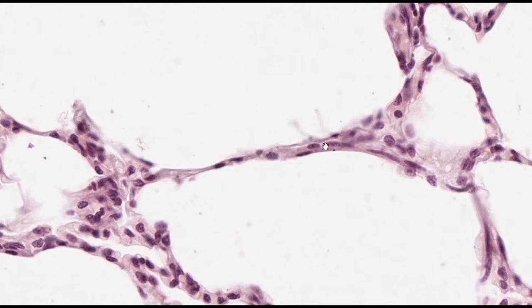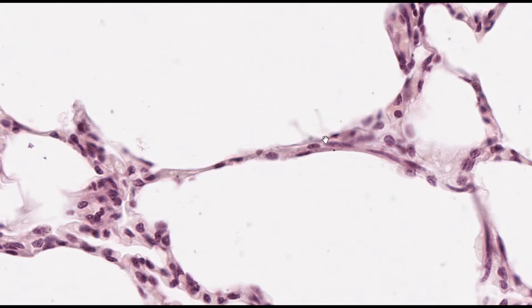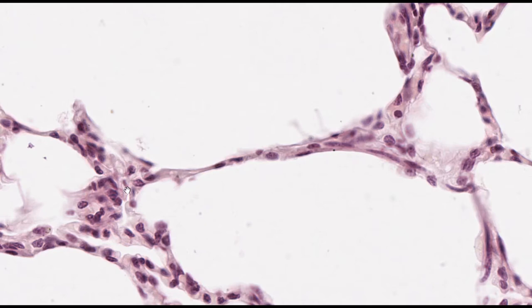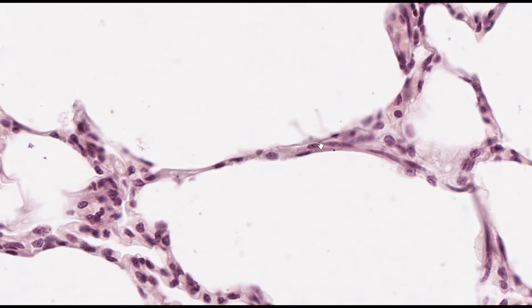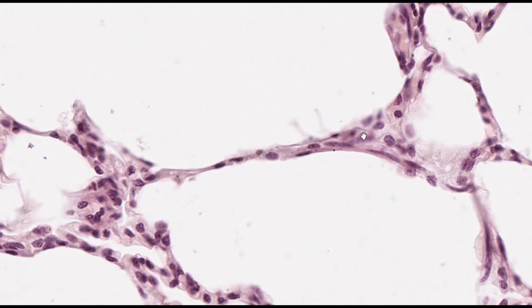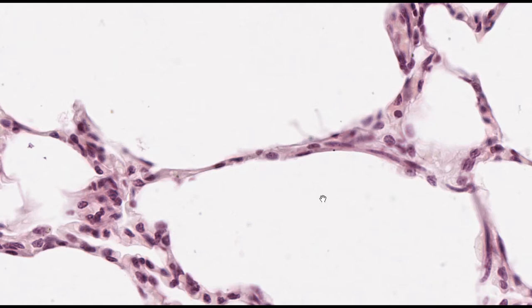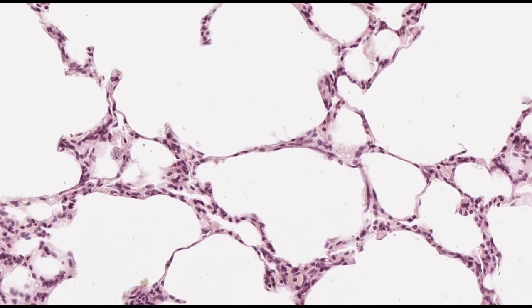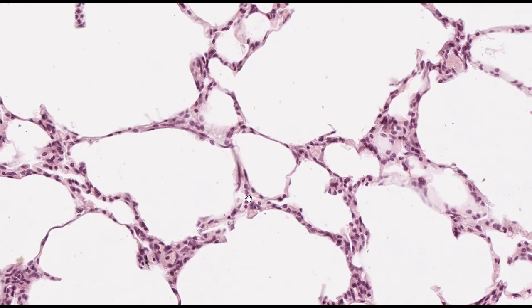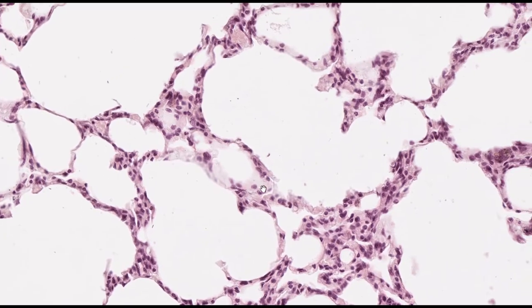On this side there should be another layer of simple squamous epithelium — we may have cut only one nucleus, and the rest is really thin cytoplasm. What we see in between the two lining epithelia is a sliver of connective tissue that's extremely thin. Within it, we see nuclei belonging to connective tissue cells. There's also some blood vessels — super-small capillaries lined by endothelial cells. This is where gas exchange would occur between the lining epithelium and the vasculature in that thin sliver of connective tissue.